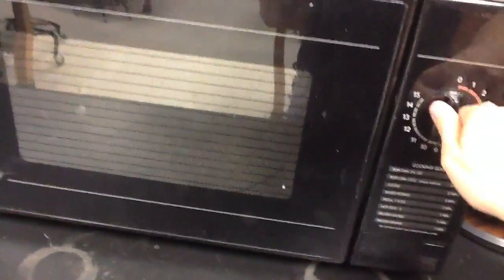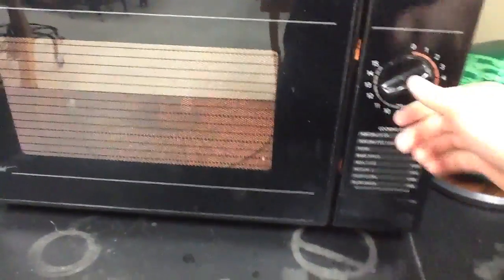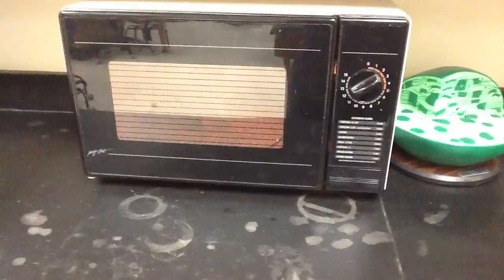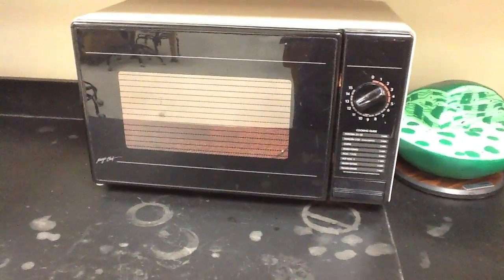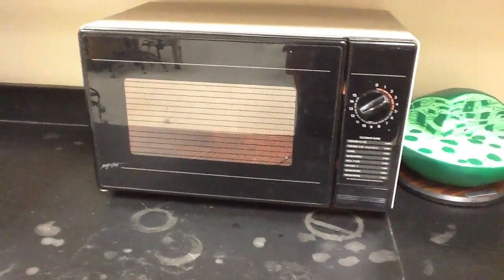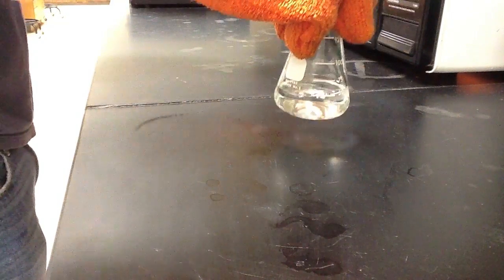We will monitor the mixture closely as it sits in the microwave to ensure that it doesn't burn. Once the mixture begins to boil, we'll remove it repeatedly from the microwave and agitate it gently to ensure that all of the agarose has been mixed with the TBE buffer.